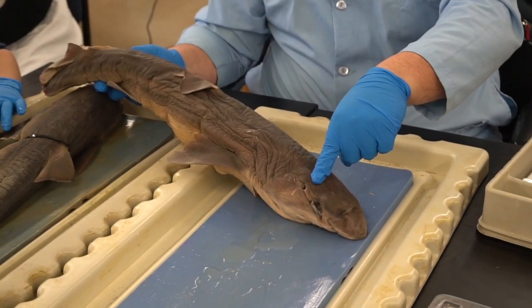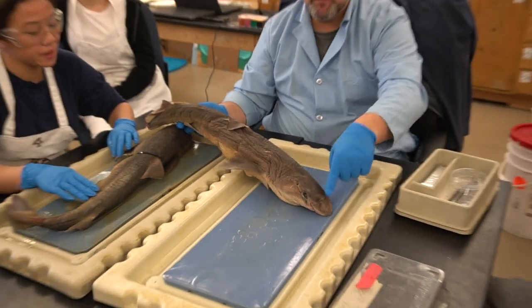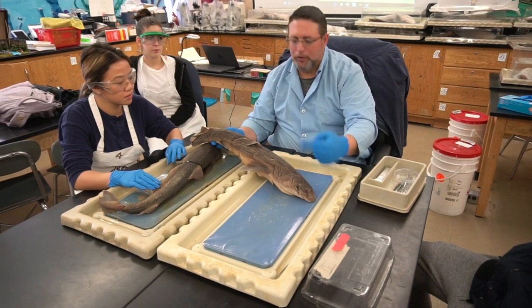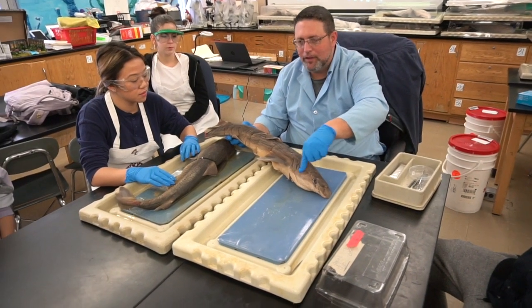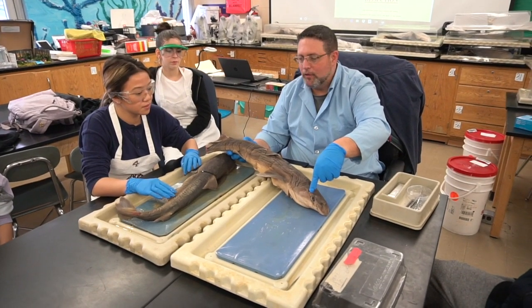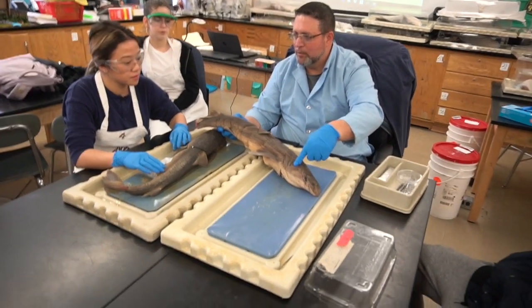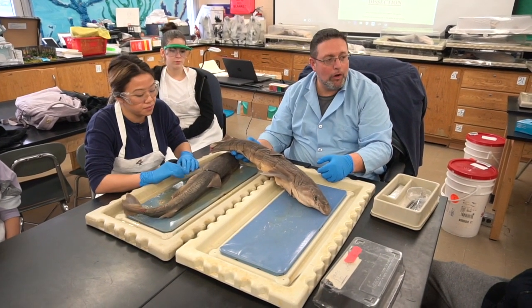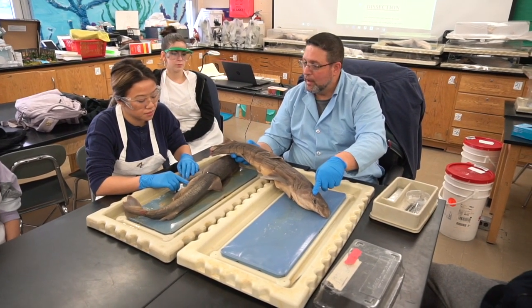These aid in water flow. Remember, sharks can't breathe unless their mouth is open. Water flows in, it comes across the gills. Remember, these are the gill slits on the side. So the connection comes this way. This is also a point that water can be expelled, hence drawing more water into the mouth. So it acts like a negative pressure draw. That's what the job of this guy is.